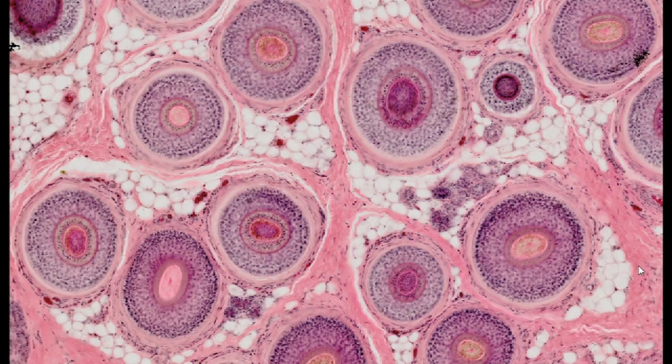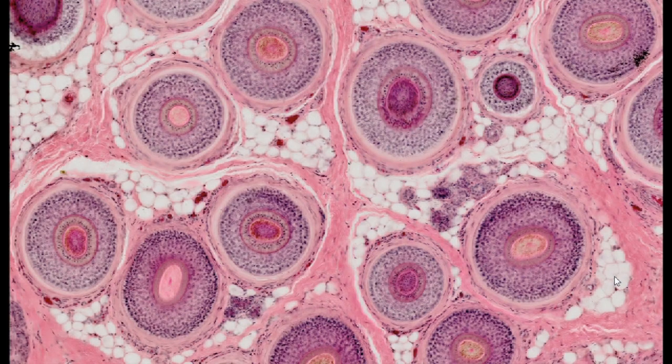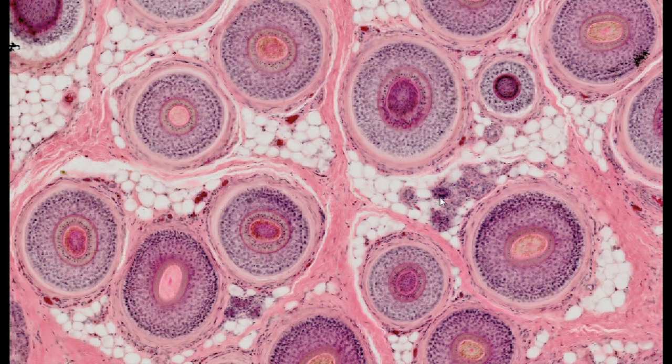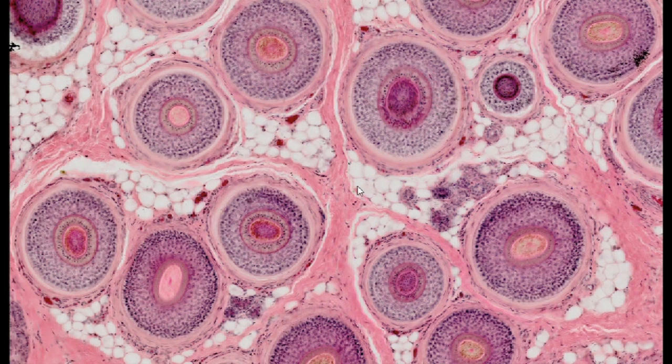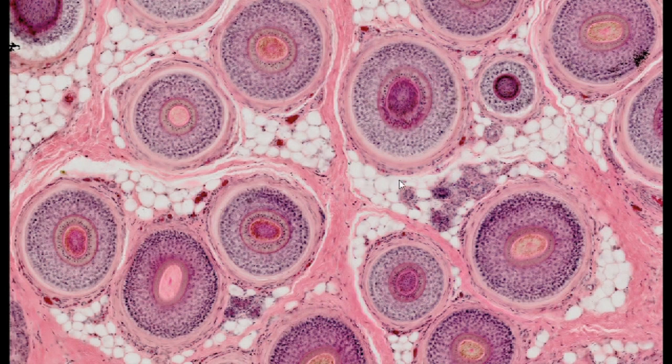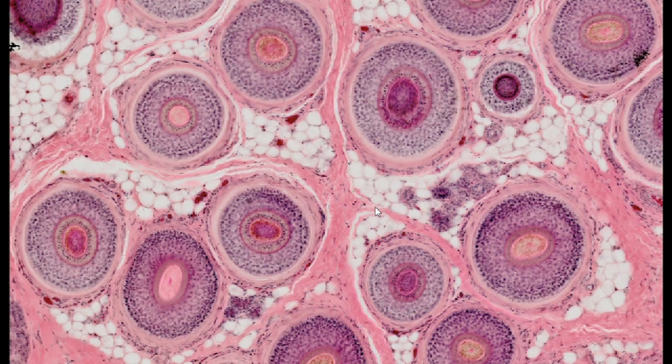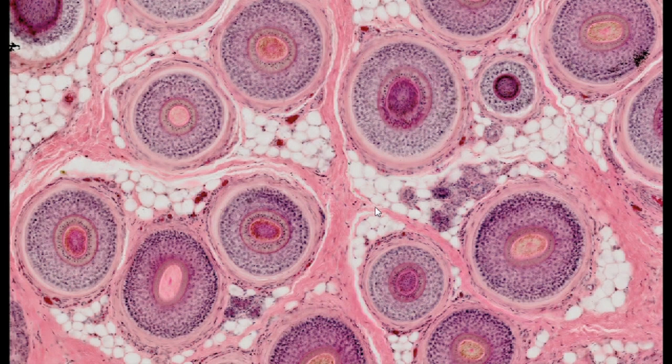Yellow adipose tissue, H&E staining. The specimen is yellow adipose tissue in the subcutaneous tissue after routine histological staining with H&E.